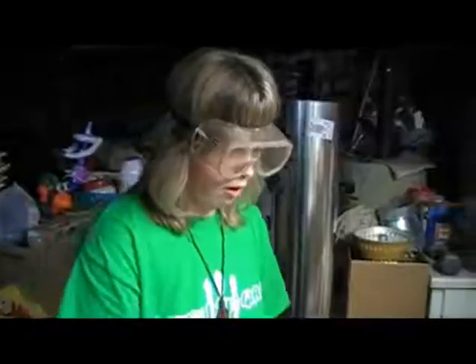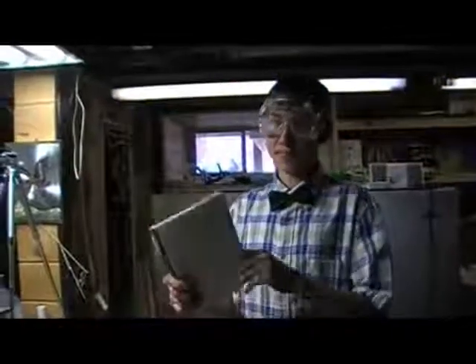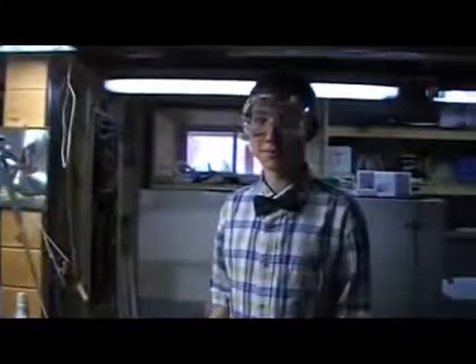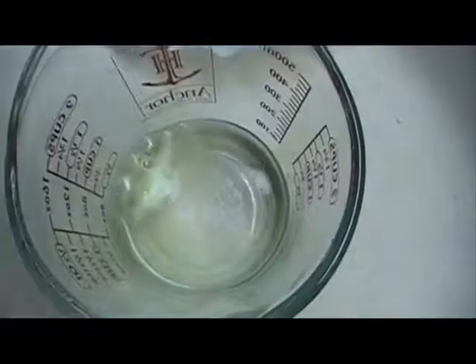Wow! Cool! Wonder what it smells like. No! My hazard book clearly states that you're not supposed to smell anything in the laboratory. And if you're gonna smell anything at all with the permission of your instructor, you should waft it. The goggles will not protect your forehead. See what else this reacts with. No, what are you doing? Chug, chug. My bad. Well, how about I just get some new stuff?